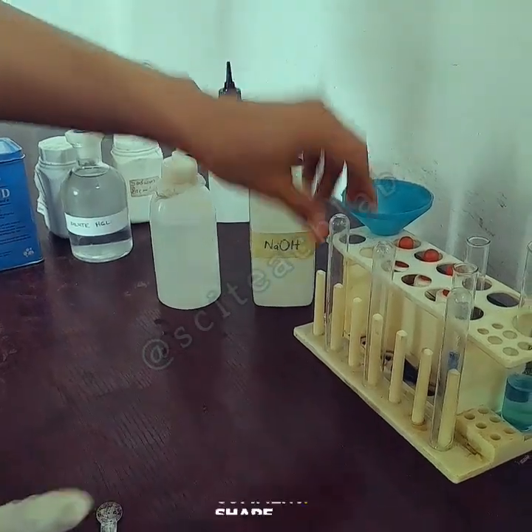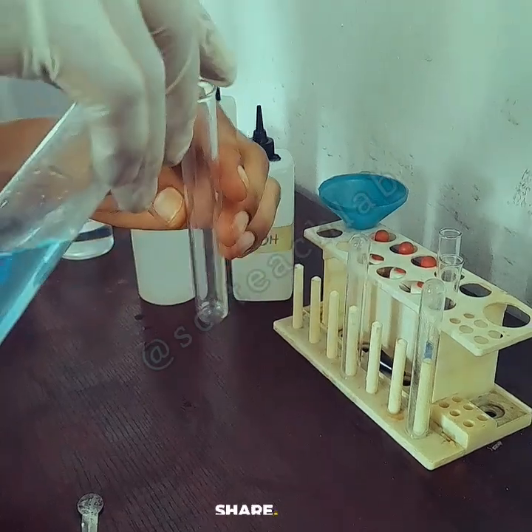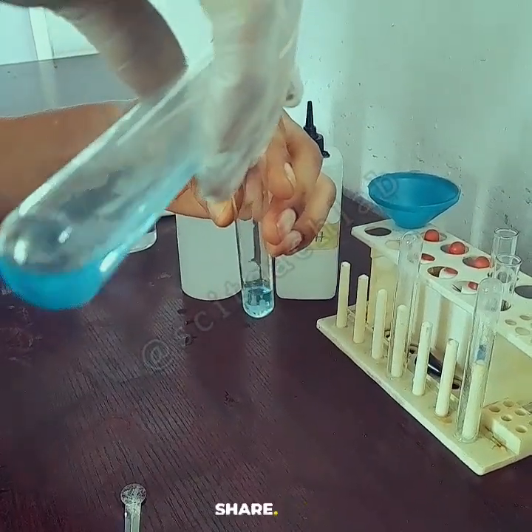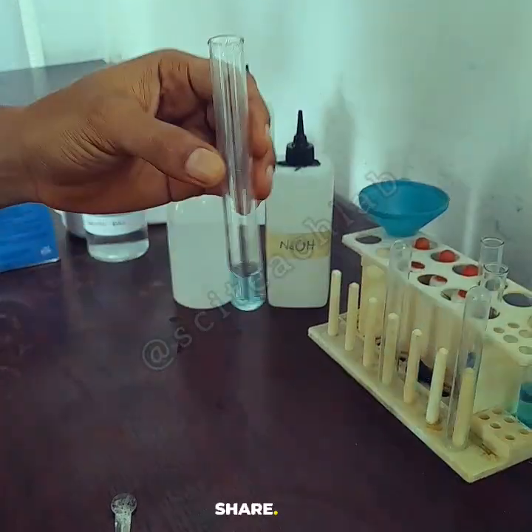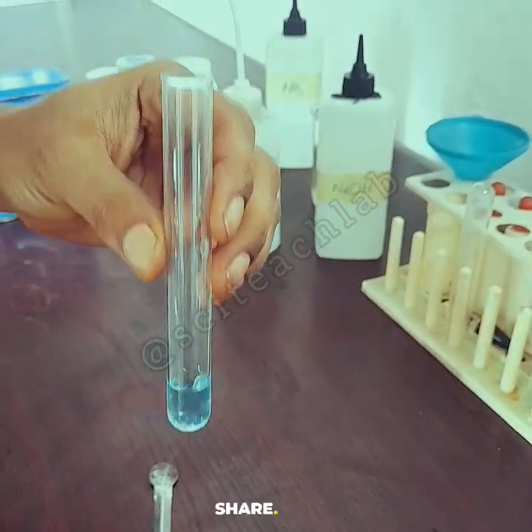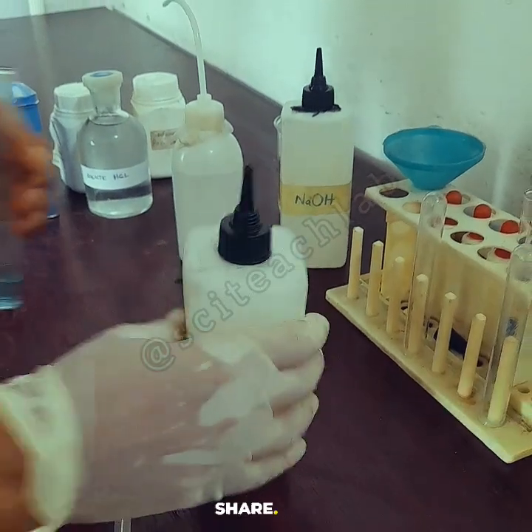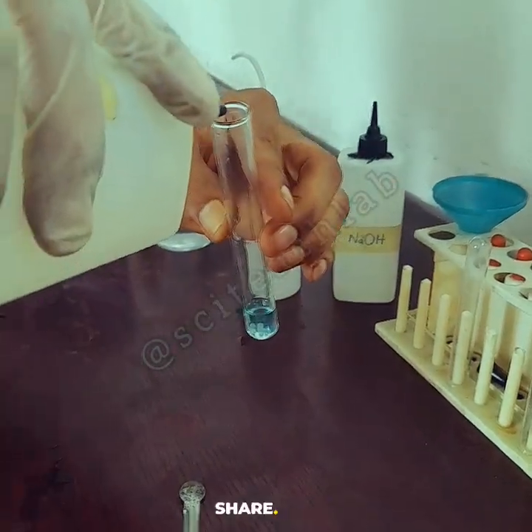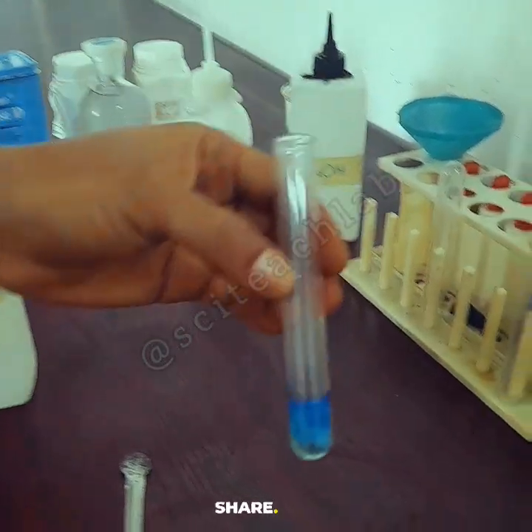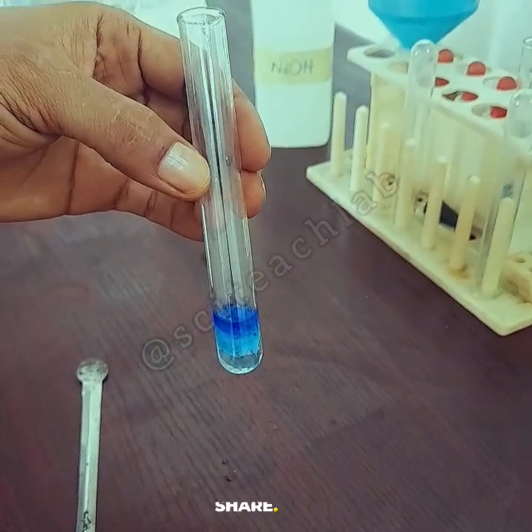But we have to confirm, so in the confirmatory test you pour a little amount of the solution of C into another test tube like I've done right now, and this time we're going to test with another reagent, ammonia. Also in drops, remember, and then you observe what happens, and then in excess. I'm adding drops of ammonia right now, 1 or 2 drops, and my blue precipitate also forms, and it's also gelatinous.